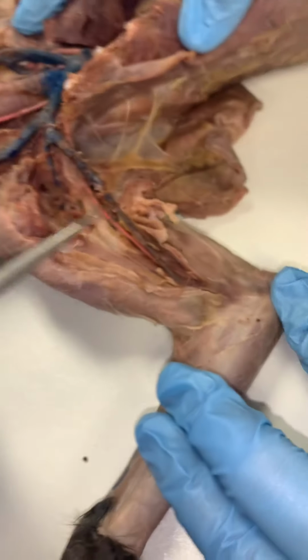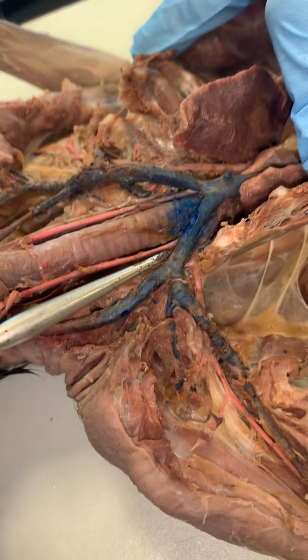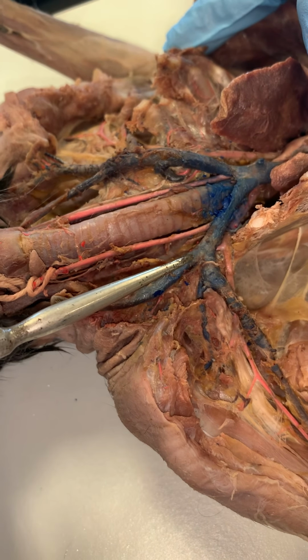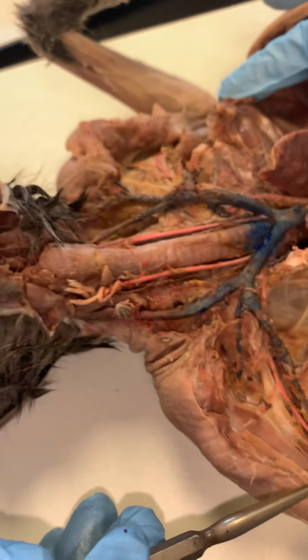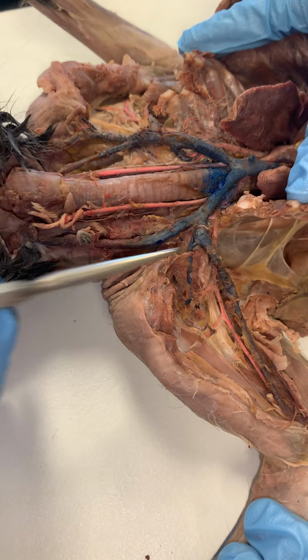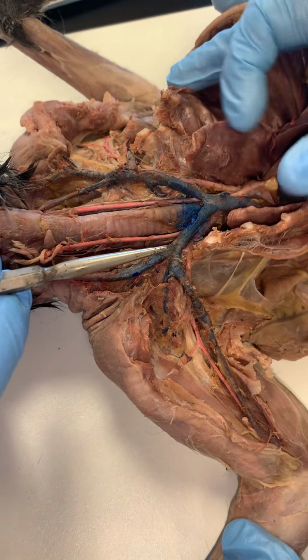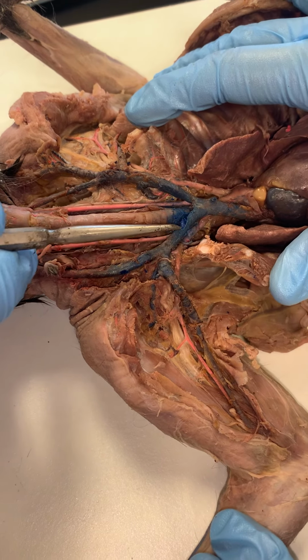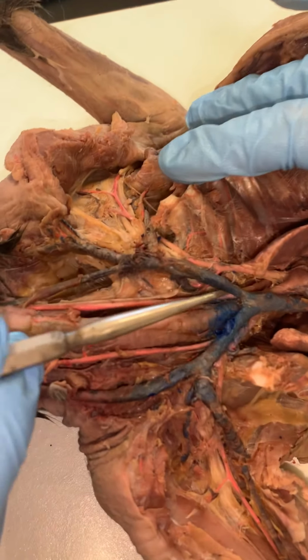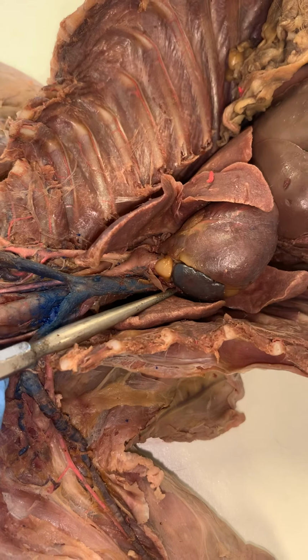If we look on the side of the neck, coming down and joining the brachiocephalic is the external jugular vein that you see right here. So the brachial coming in to the axillary, to the very short subclavian, and the external jugular coming down here, these 2 vessels will form the right brachiocephalic. The right brachiocephalic will join the left and form the superior vena cava into the right atrium here.